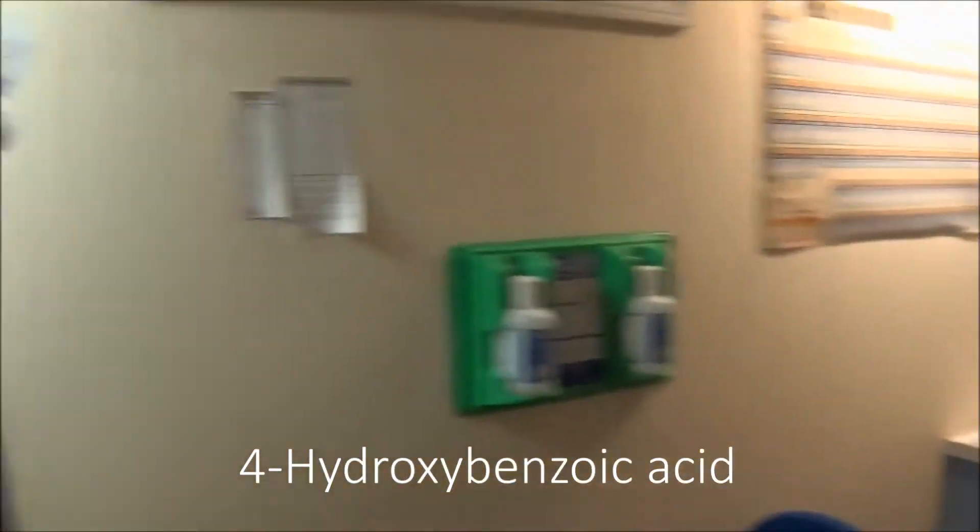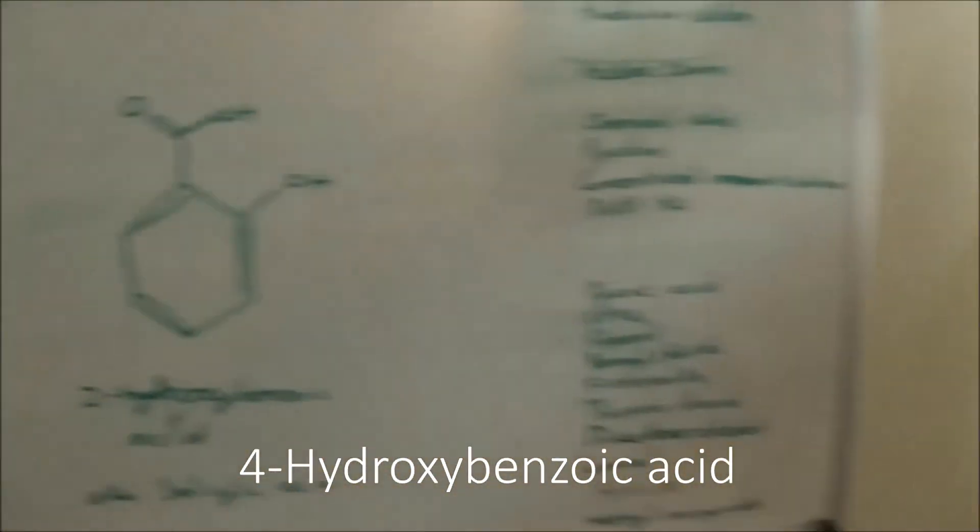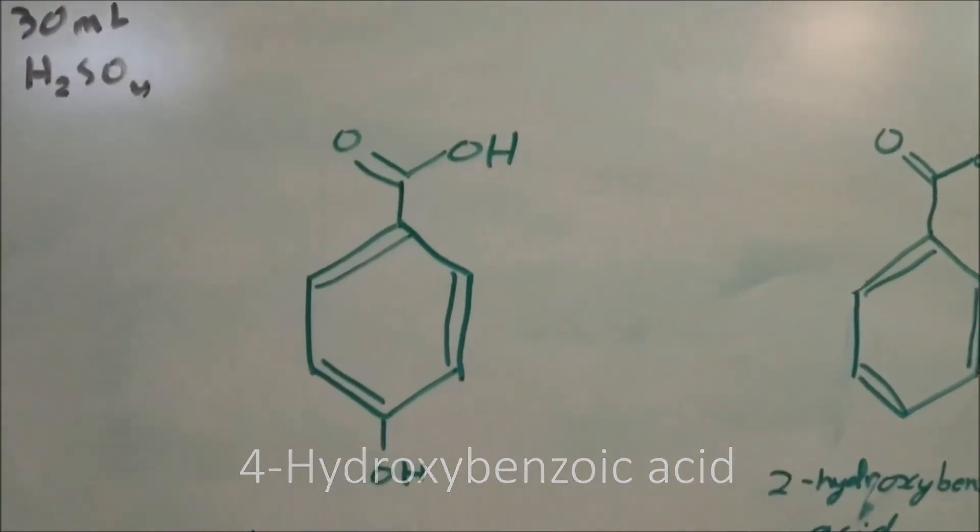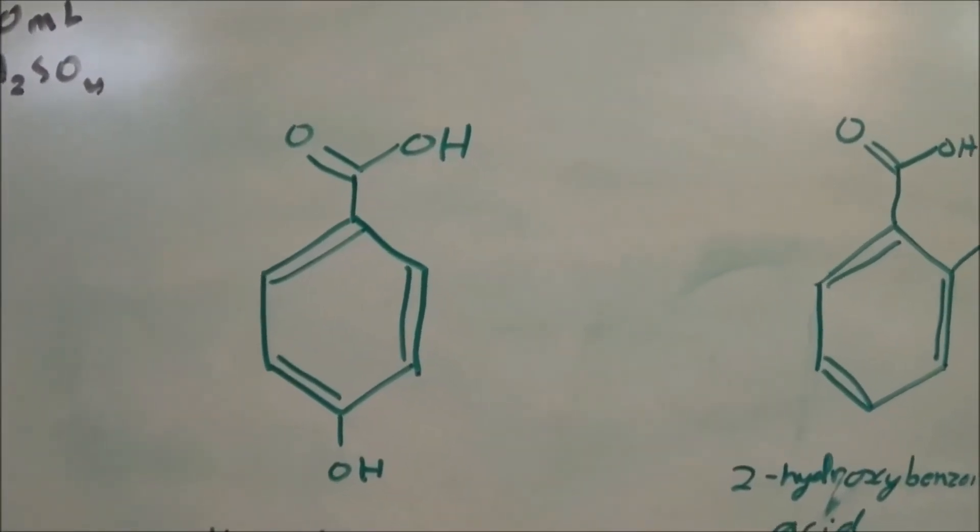Hello everyone, and welcome back to the lab. In this video, I'll be preparing the molecule that you see here, 4-hydroxybenzoic acid.